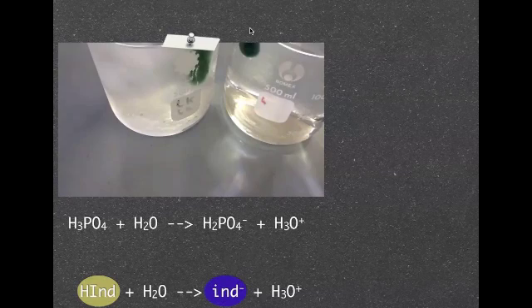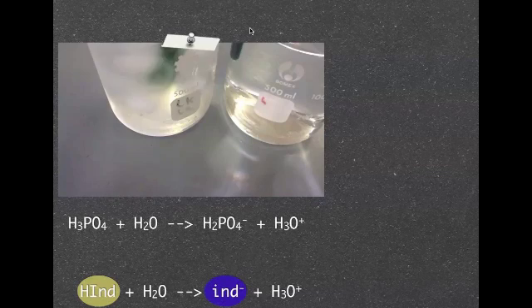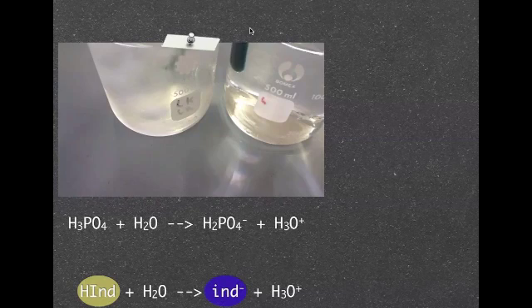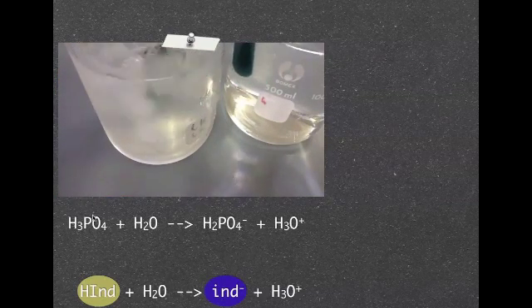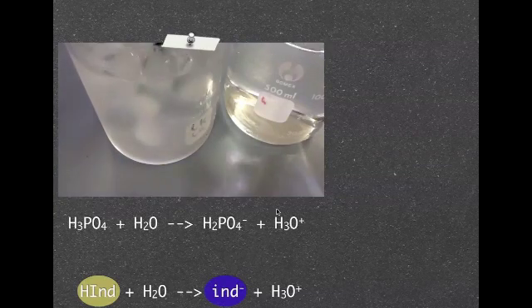I've just let it change color so you can think about what's happening to the indicator and what's happening to this, which way the reaction is going and from that we can determine whether this dissociation of the phosphoric acid is going to be endothermic or exothermic.